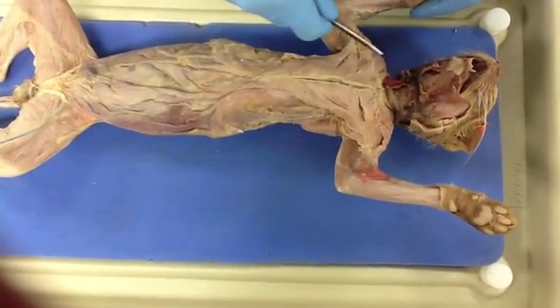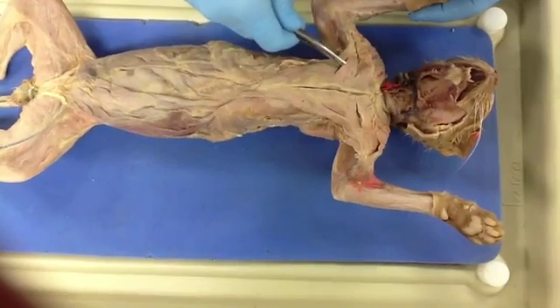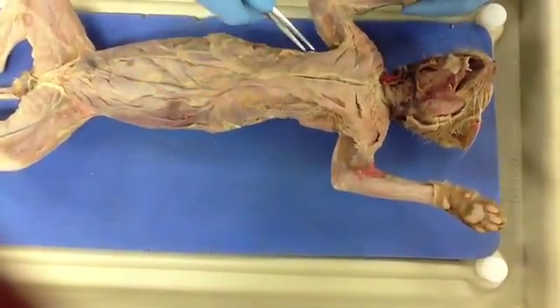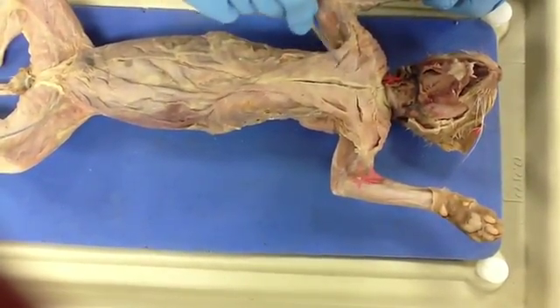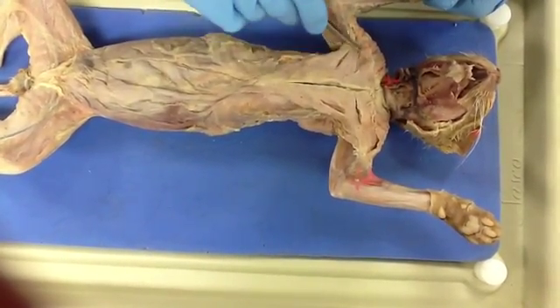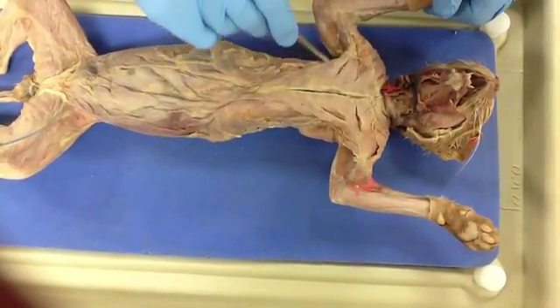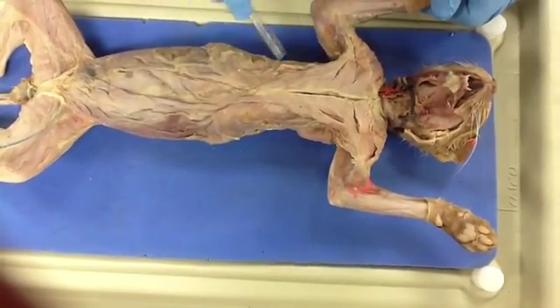Then this muscle right here is the pectoralis major, and it's right here and here, and these are the pectoralis minors. And the major difference between these two muscles, there's not really a major difference in the grouping of them. It's just that the fibers of the pectoralis major extend horizontally more and straight into the sternum, and the pectoralis minor extends farther down into the sternum.